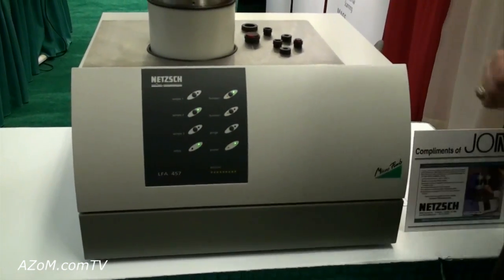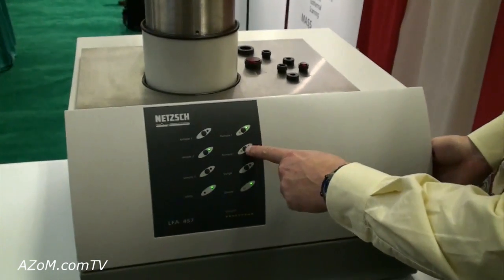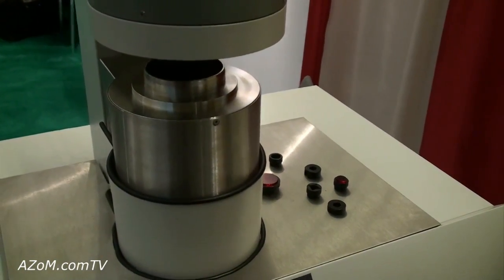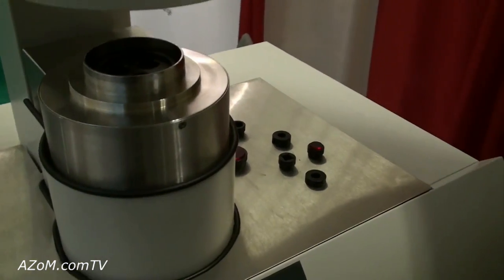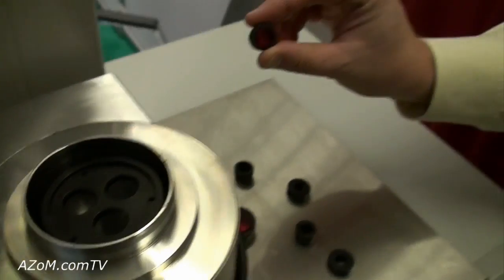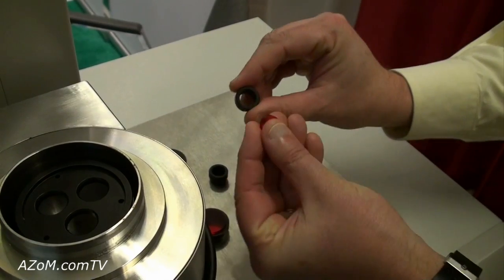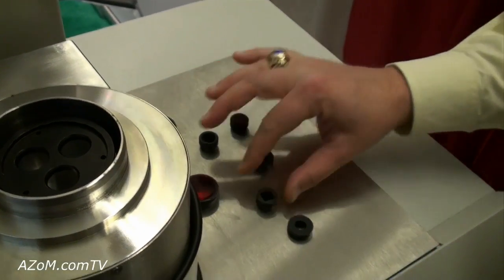I'll show you now just how the samples are input into the instrument. What I'm doing now is lowering the furnace, and when the furnace comes down you'll see that we've got the ability to put up to three samples in place. This is just an example of a type of sample — basically a model. It could be a small disk or it could be a small square.